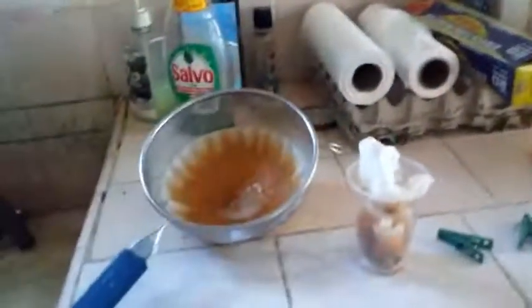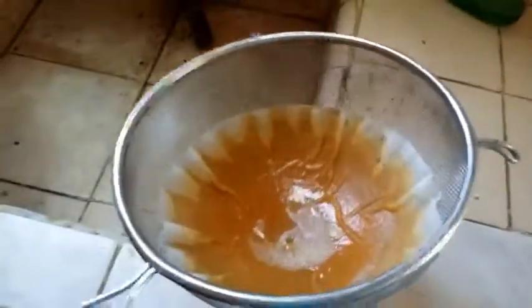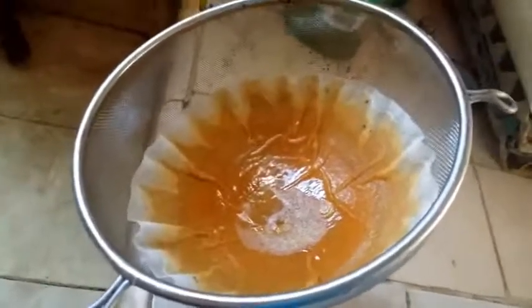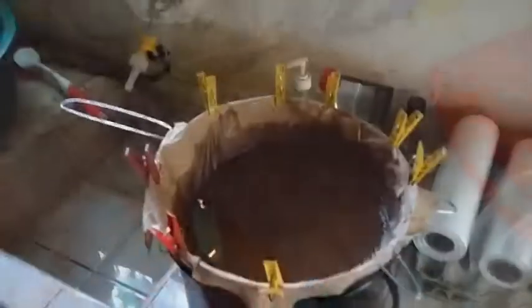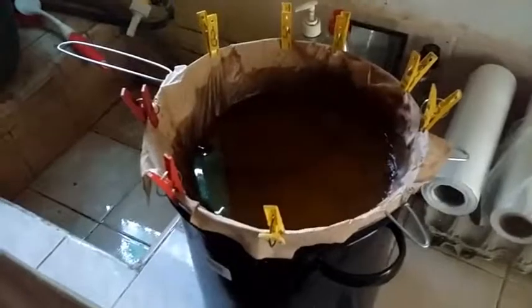Before I did that last night, I ran it through three filters. You can see there's quite a bit of precipitate — quite a bit of material that I filtered out — and it's all that iron(III) sulfate color. All these filters are the same color. I made this big filter to filter out my zinc sulfate solution.